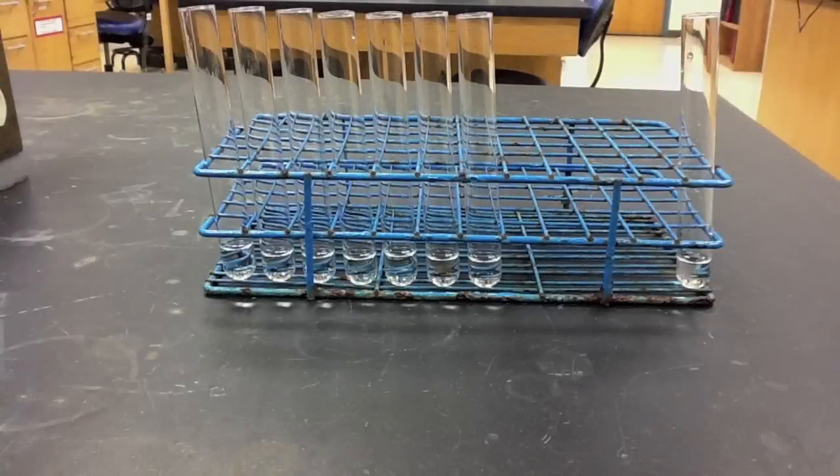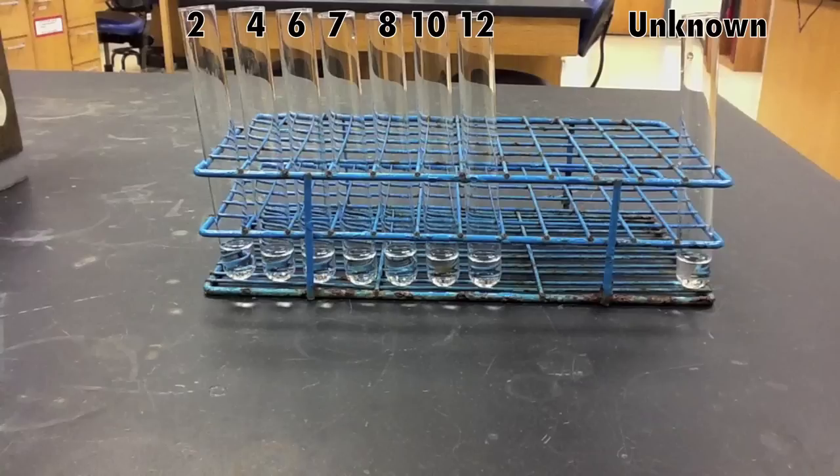I've pre-prepared eight test tubes here. On the left-hand side, these seven test tubes contain buffers of pH 2, 4, 6, 7, 8, 10, and 12, respectively.